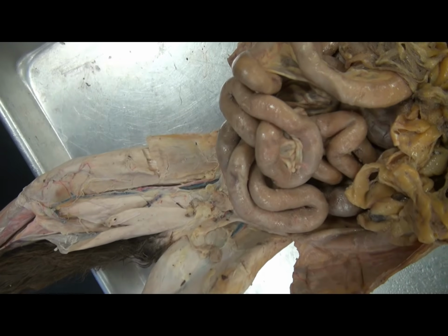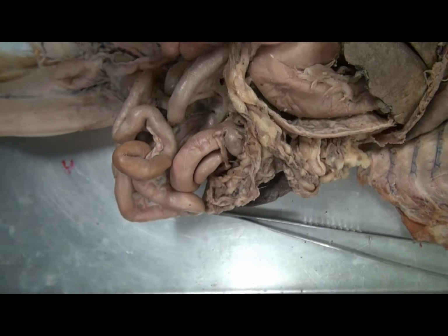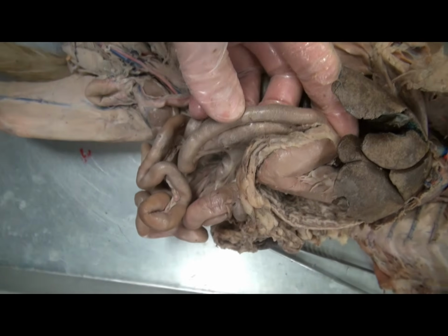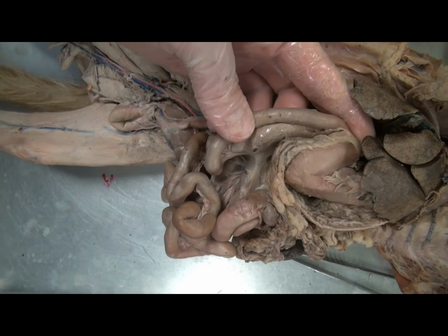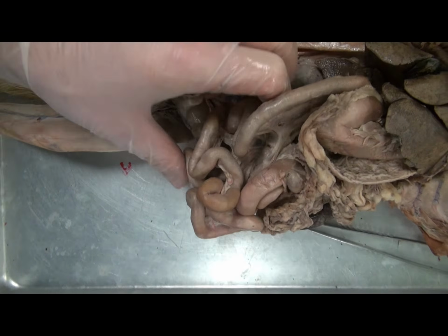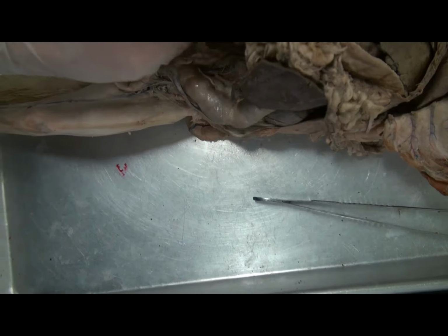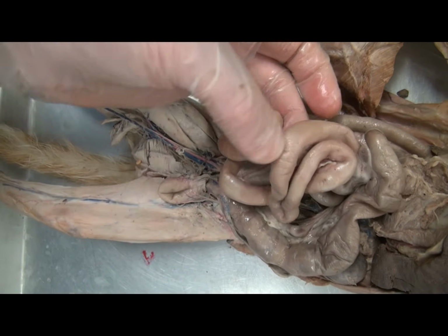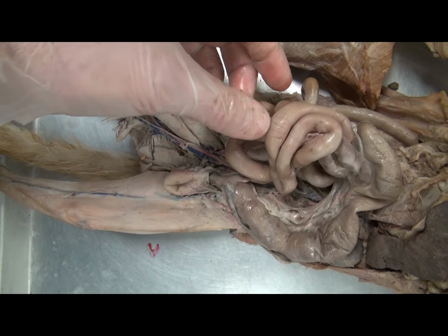The stomach is J-shaped. If one were to cut the stomach, one would see folds known as rugae. And the stomach then empties into the small intestine. The first region of the small intestine, the duodenum, is the shortest. Here there are a number of glands, not only for digestive enzymes, but also to neutralize stomach acid. From there, the small intestine is known as the jejunum, and then it is the final portion, the ileum, which is not only the largest, but also empties into the large intestine. So this would be the ileum emptying into the large intestine here.